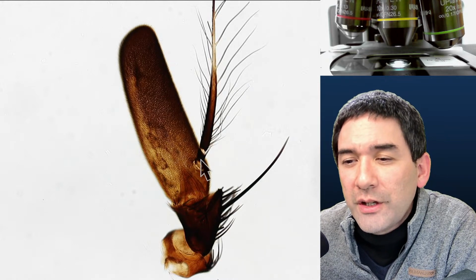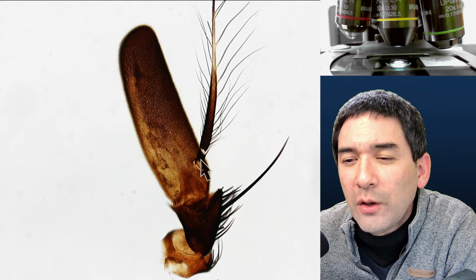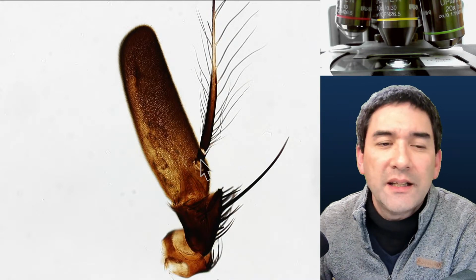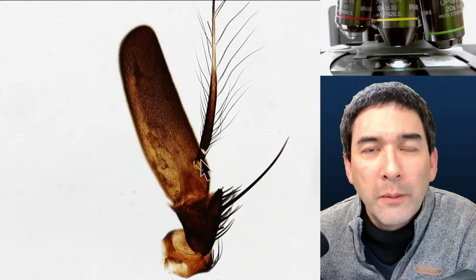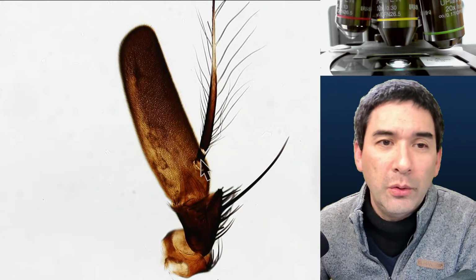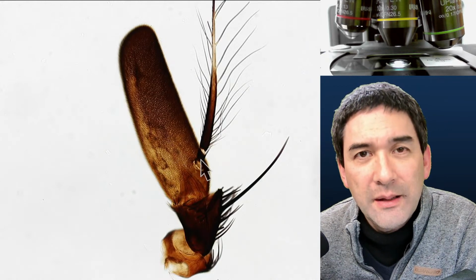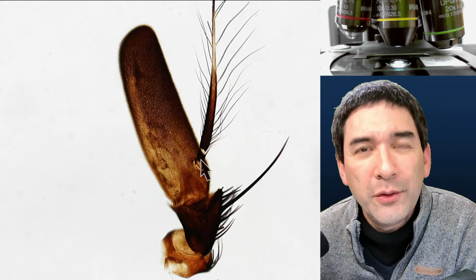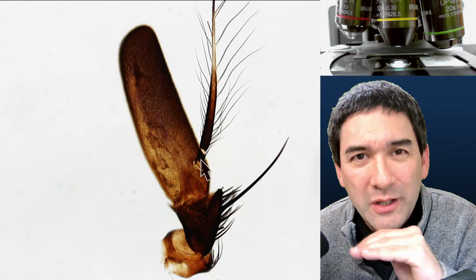So there's an interesting question here. I'm sorry if I misunderstood, but why whole mount when they only show a part of an insect? That's a good question. You call it a whole mount, WM, but you only basically show an antenna. The reason is it's still considered a whole mount because we take the whole part and mount it. We do not cut it.